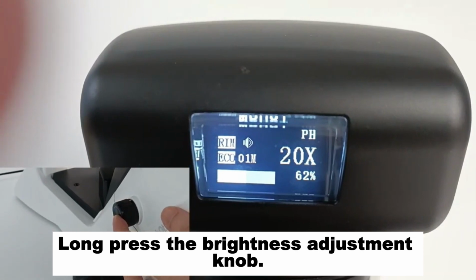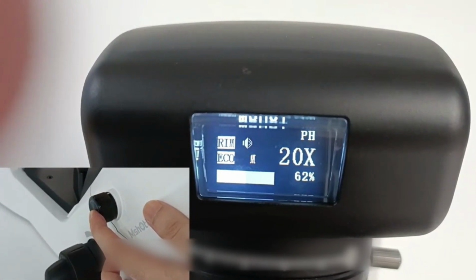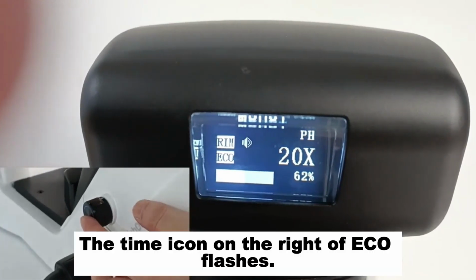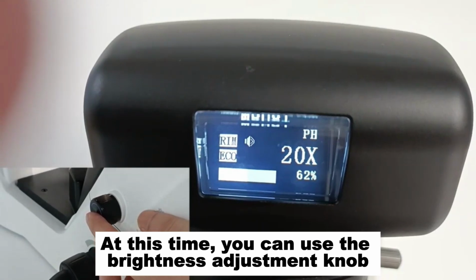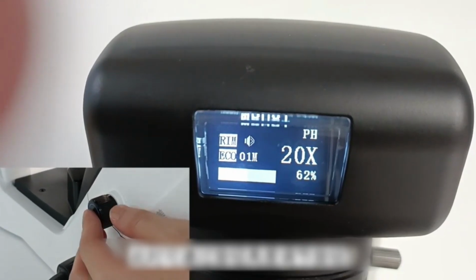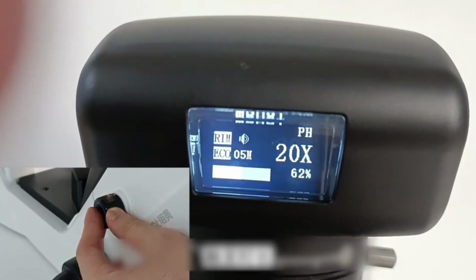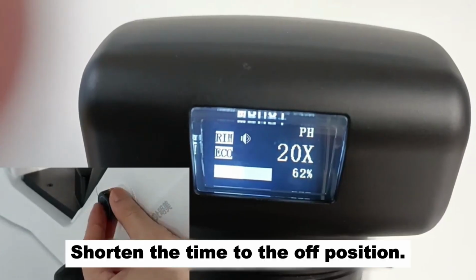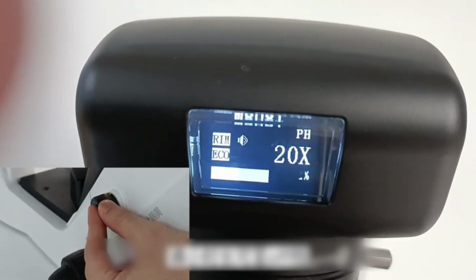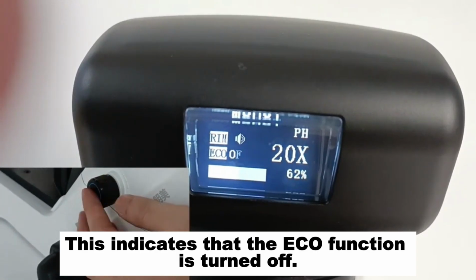Long press the brightness adjustment knob. The time icon on the right of Eco flashes. At this time, you can use the brightness adjustment knob to set the trigger duration of the Eco function. Shorten the time to the off position. This indicates that the Eco function is turned off.